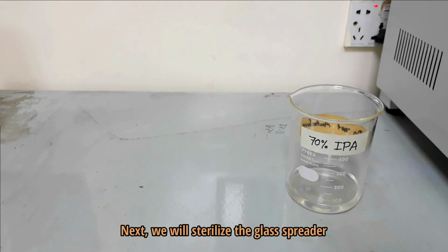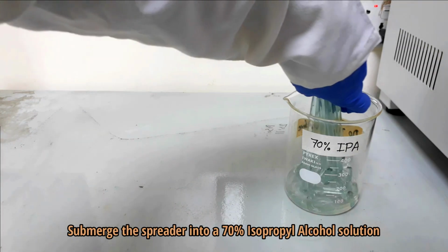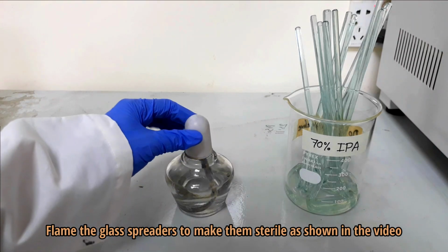Next, we will sterilize the glass spreader. Submerge the spreader into a 70% isopropyl alcohol solution, then flame it as shown in the video.